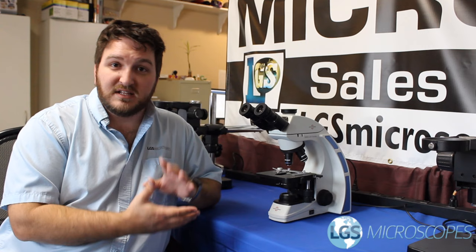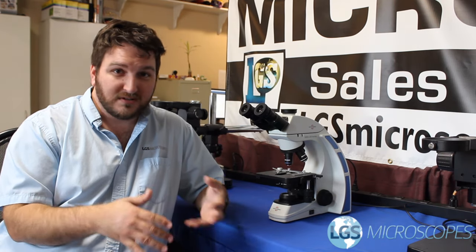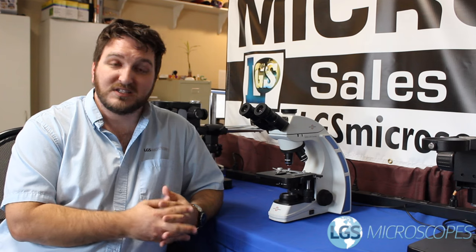There are many lenses inside of each objective and so it has to go through the entire manufacturing process again in order to clean it. Therefore it's always cheaper to just replace your objective and that's not cheap. So we're going to go over how to properly use immersion oil so that this doesn't happen to you.